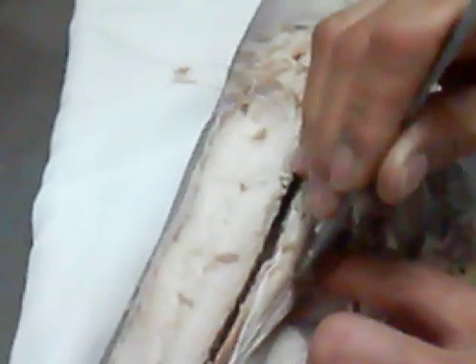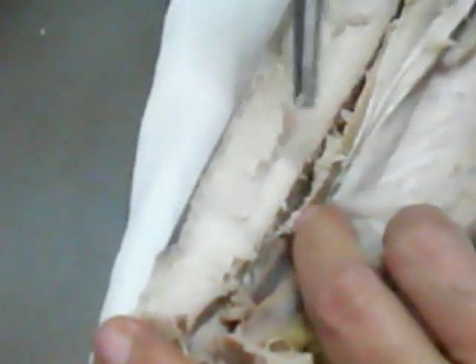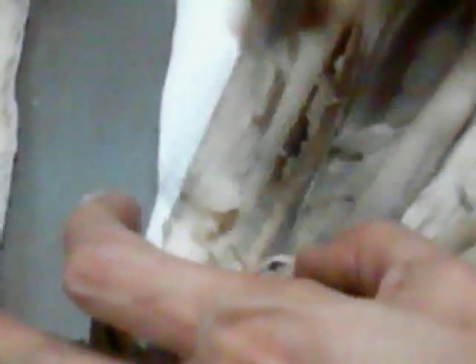After doing that, lift what you have exposed there. What you will see now is the upper part of the opisthonephros — the kidney — which is reproductive in function. You call this the epididymis. On top of the epididymis is a very coiled tube, and we call that the epididymal duct.